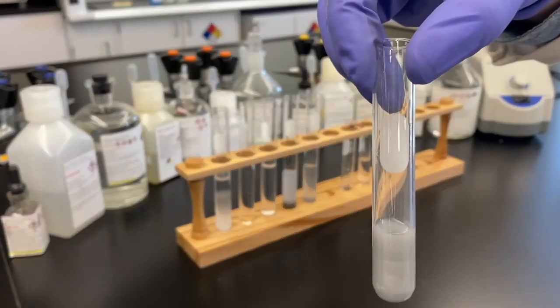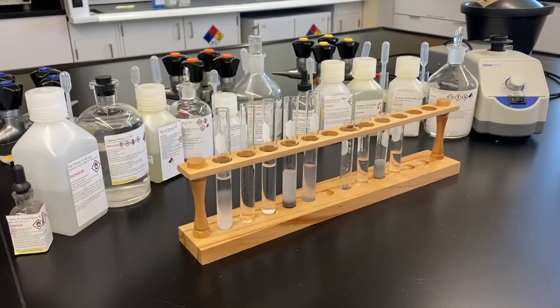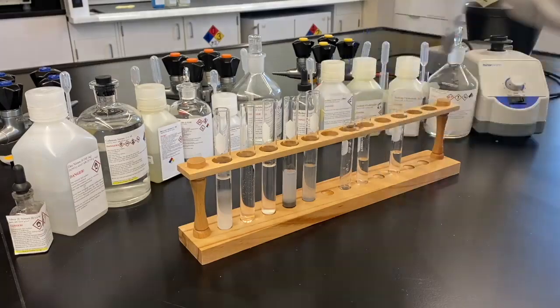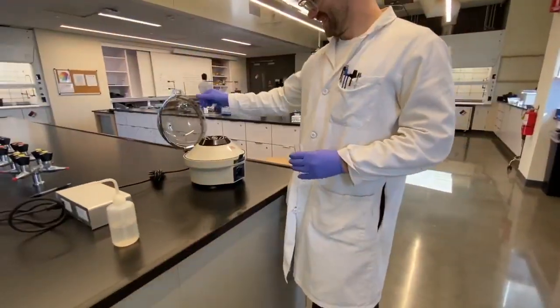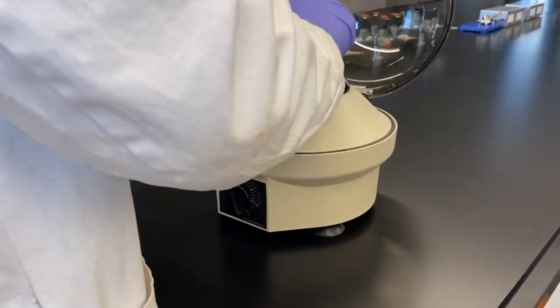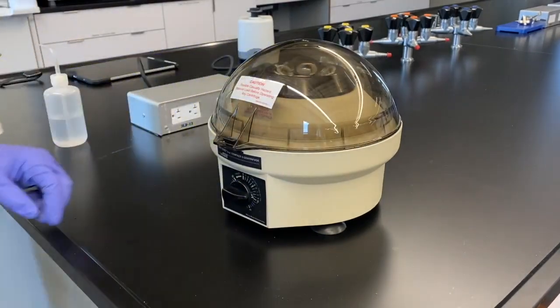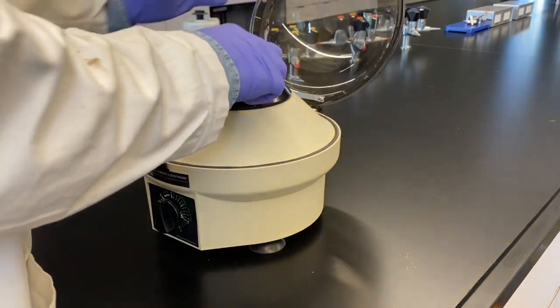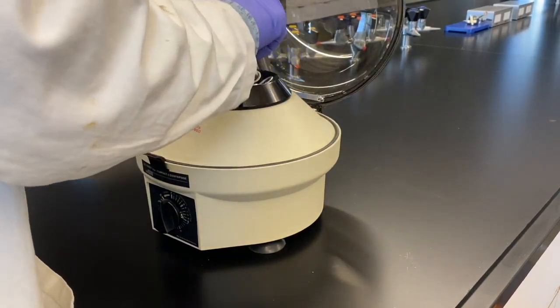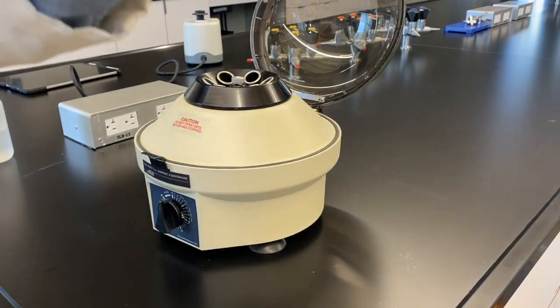So recall too, though, that cadmium didn't make a precipitate when we added the tin chloride. So in the solution, there could still be cadmium present. We'll have to test for that. We're going to centrifuge it down. The pellet will have the mercury. If cadmium is present, it'll be in the supernate. So we'll pour that off and test it for the presence of cadmium by adding sodium hydroxide.